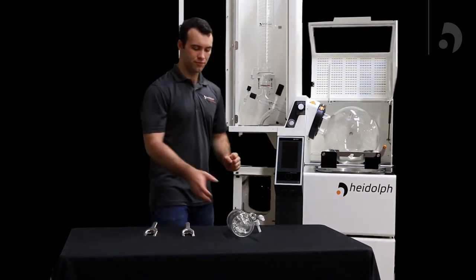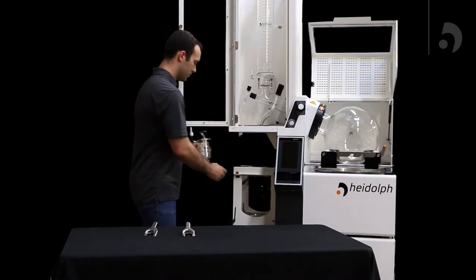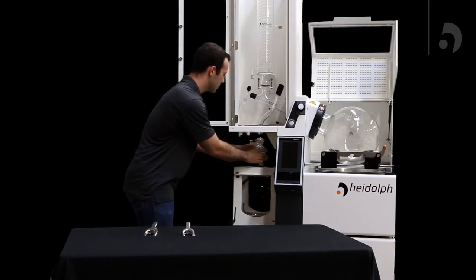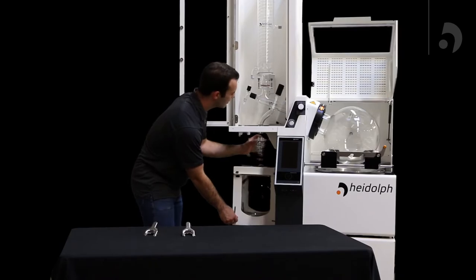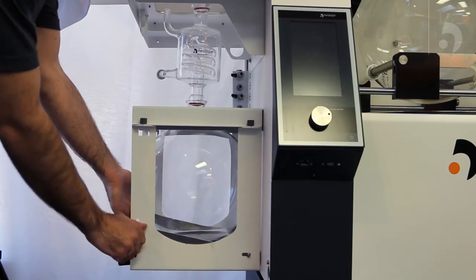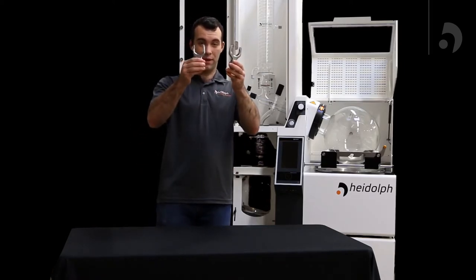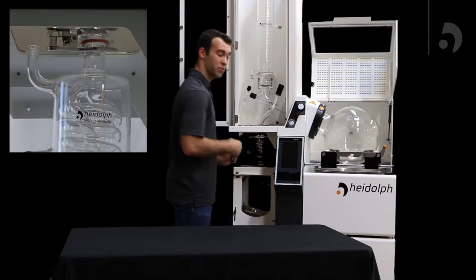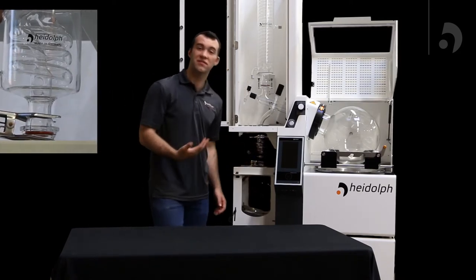Now we're going to add the mini condenser. This goes in between the distributor and our receiving flask. You're going to first take the bottom and slide it into the top of the receiving flask. Loosen the screw holding up the receiving flask and lift it up until it's secure over the distributor. Then tighten that screw on the rod and take your two clamps — one over the top portion connecting the distributor to the mini condenser, and the other to the bottom portion connecting the receiving flask to the mini condenser.